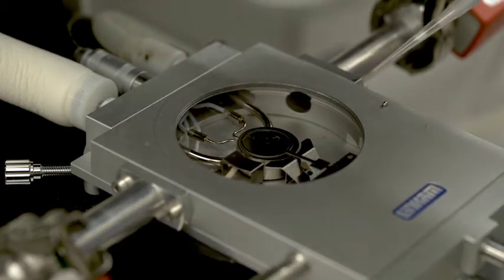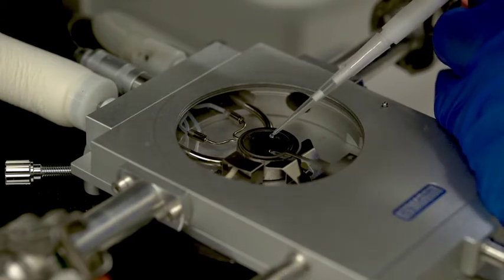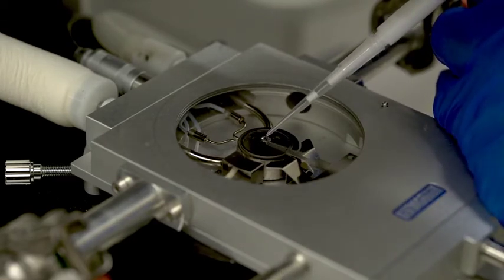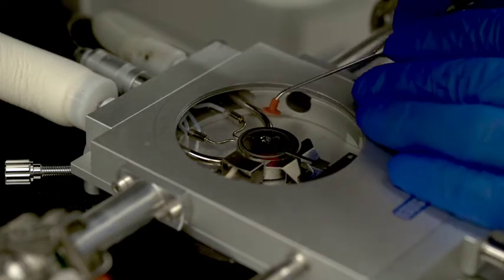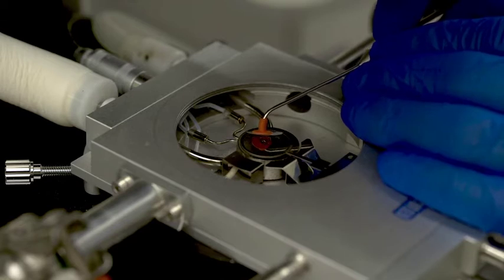Using a pipette, dispense 3 to 4 microliters of your sample onto the large glass cover slip. Using the vacuum tweezers, place a small glass cover slip over the sample.